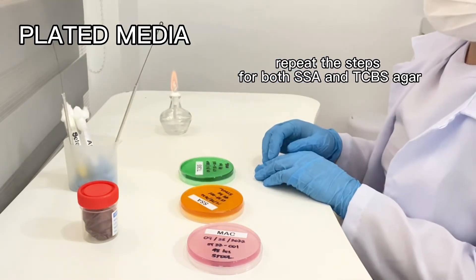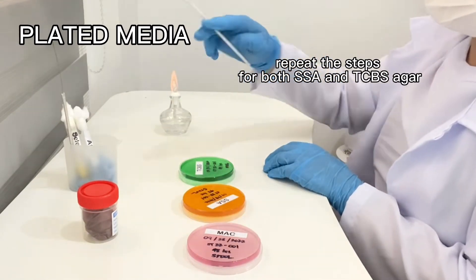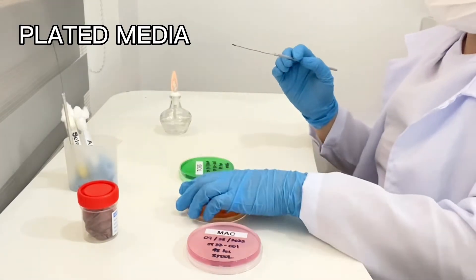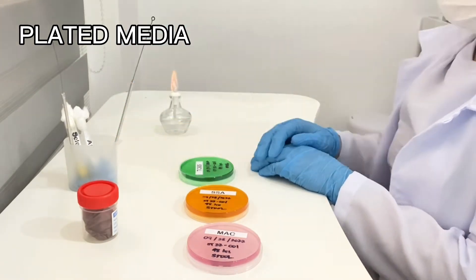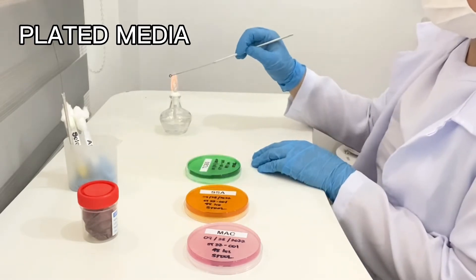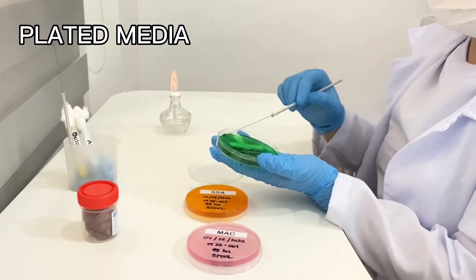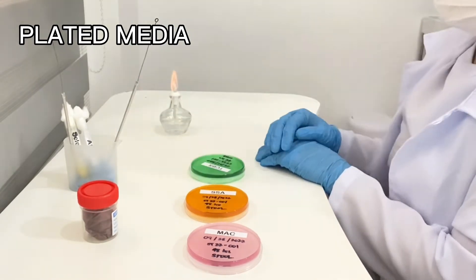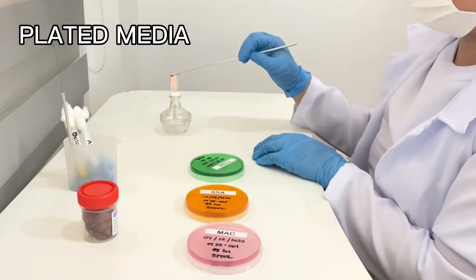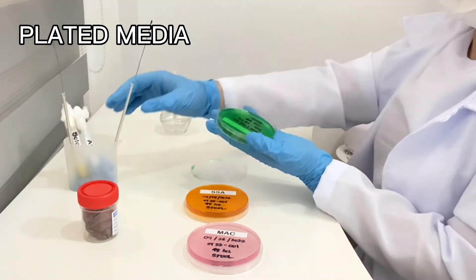In stool culture, we use three types of agar. The first is MAC or MacConkey Agar Medium, used for selective isolation and identification of members of the family Enterobacteriaceae. The second is Salmonella Shigella Agar or SSA, a selective and differential medium for isolation of Salmonella and Shigella. The third is TCBS or Thiosulfate Citrate Bile Salt Sucrose Agar, a selective differential medium for isolating and cultivating Vibrio cholerae and other Vibrio species.